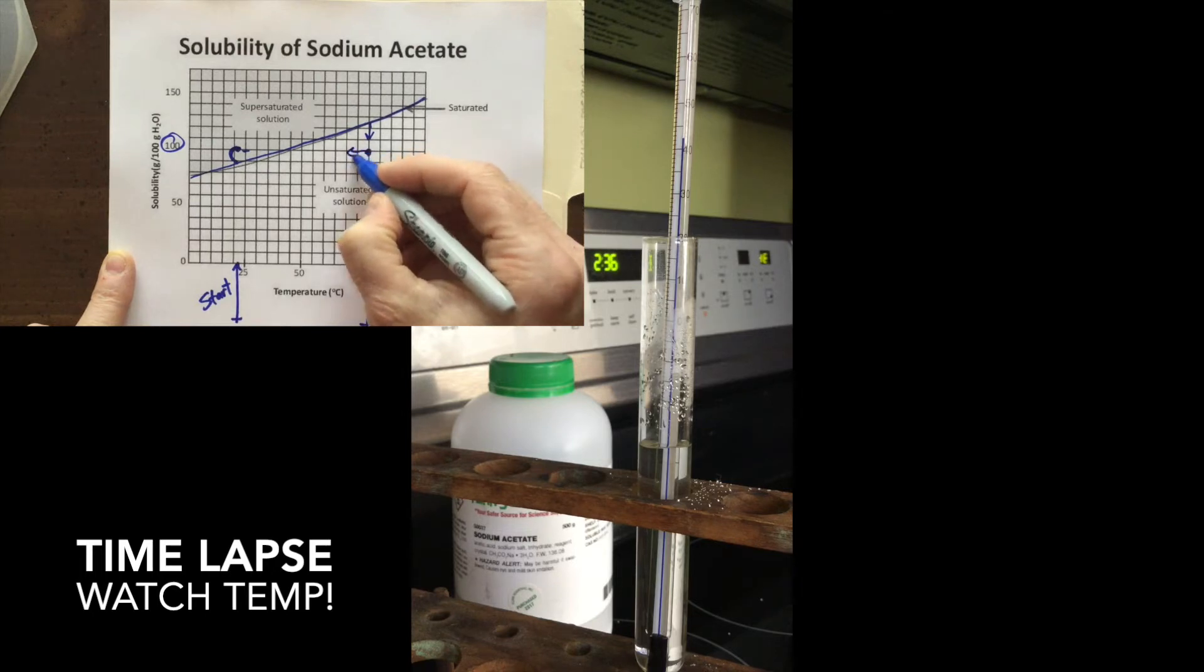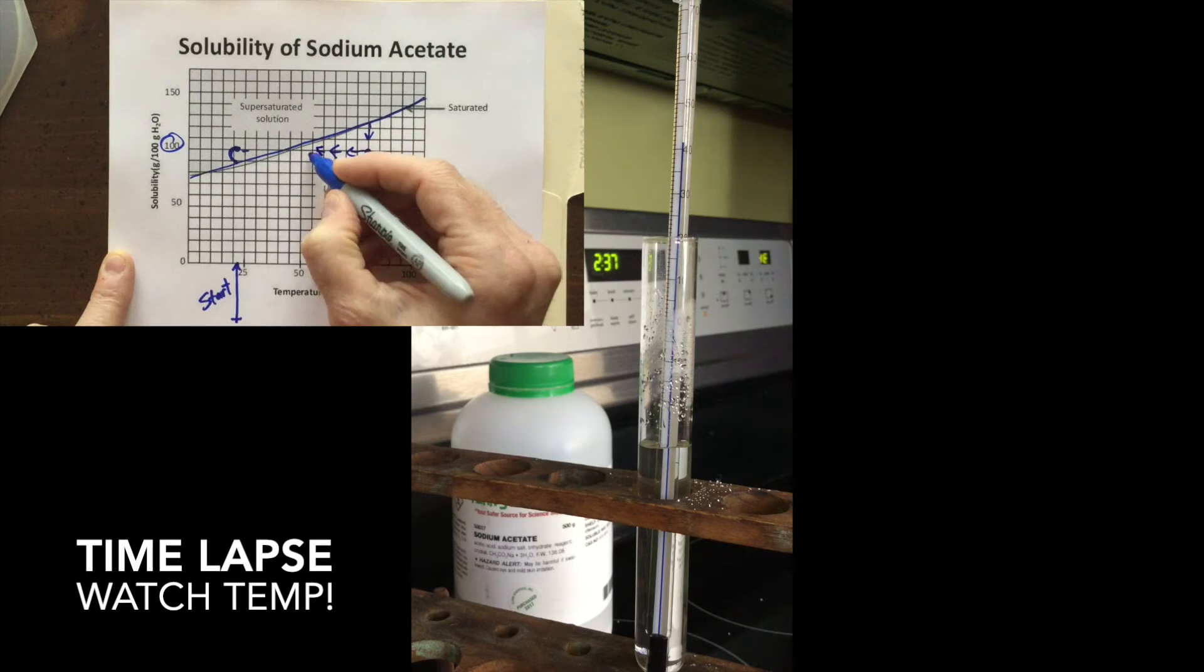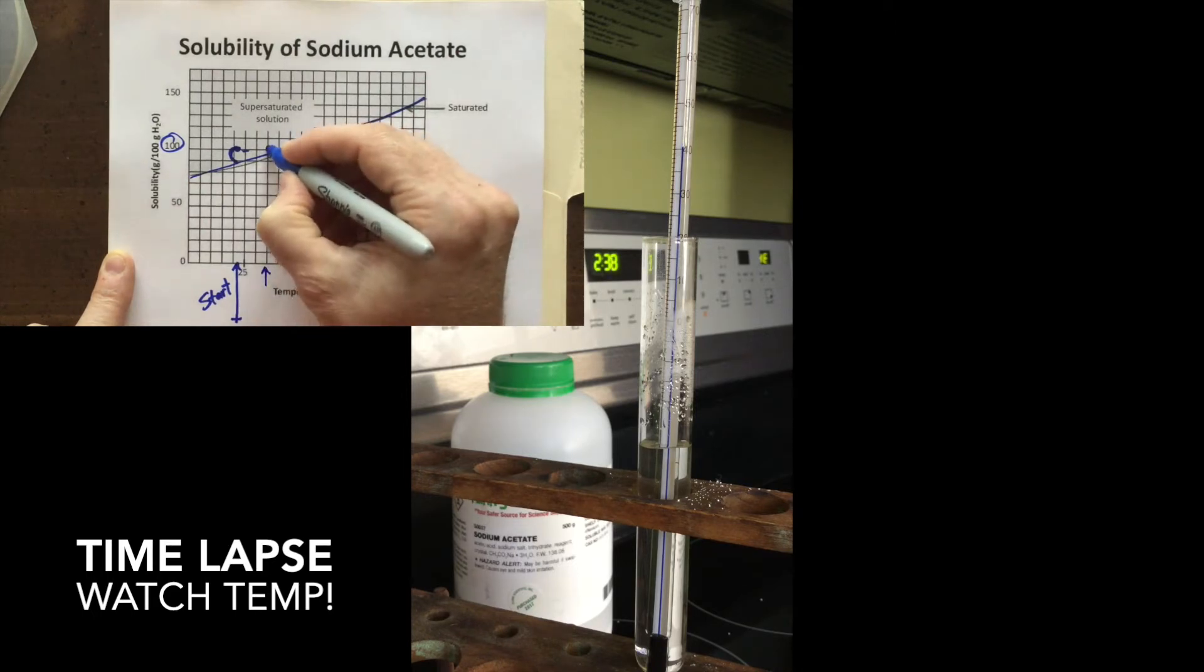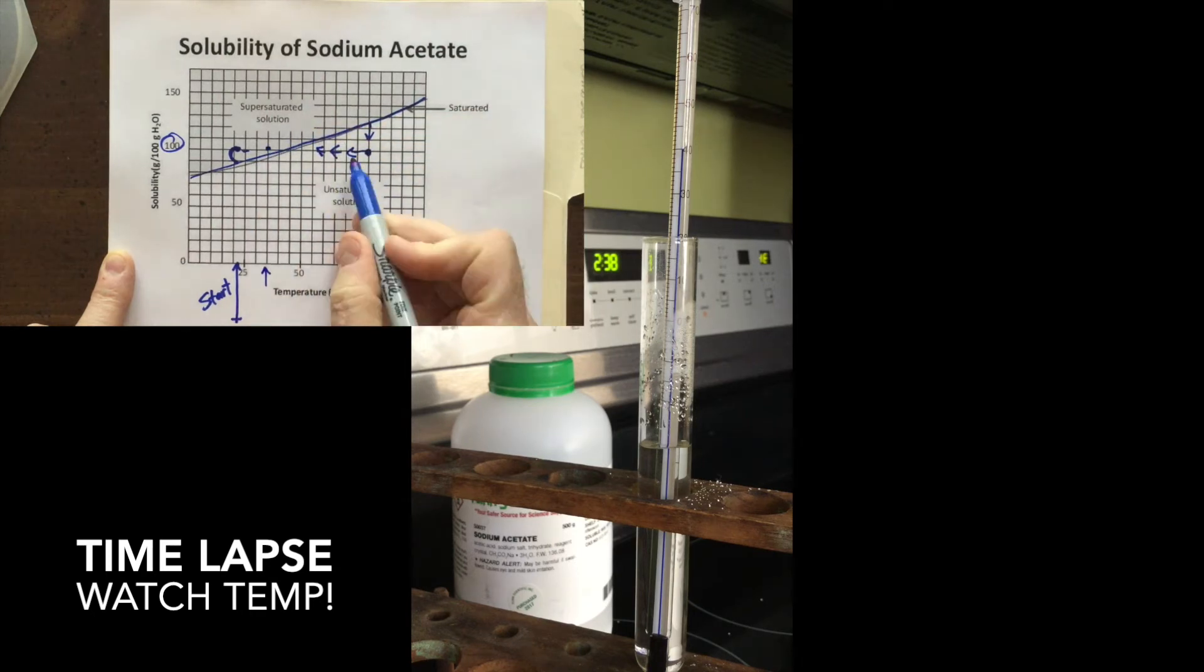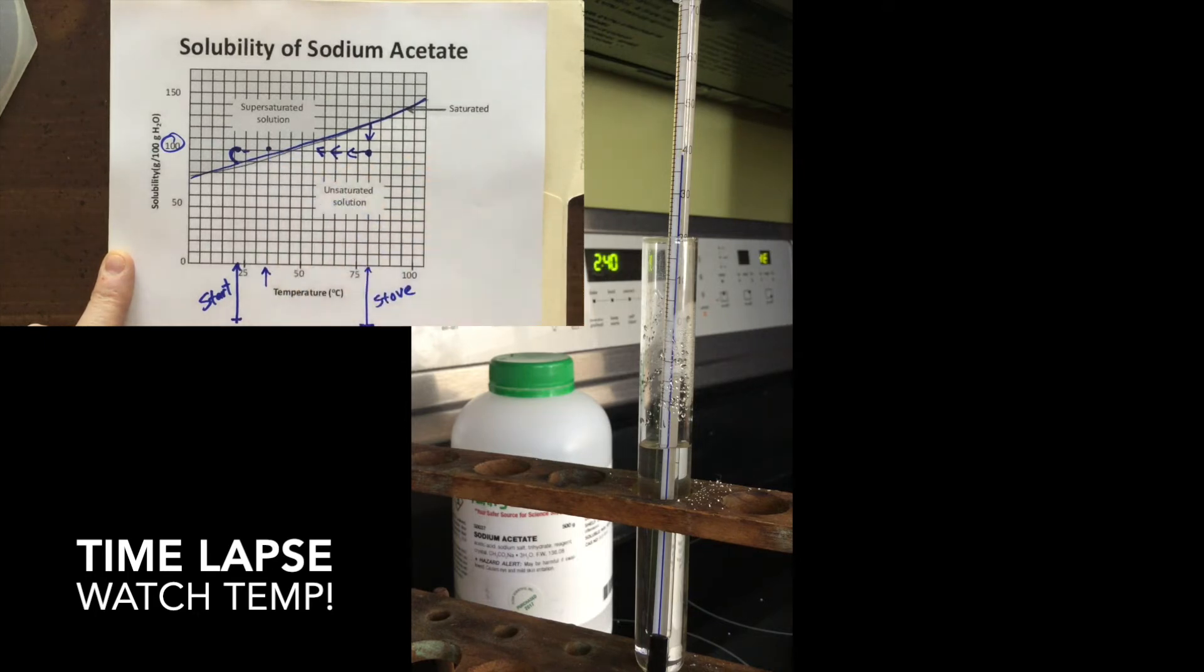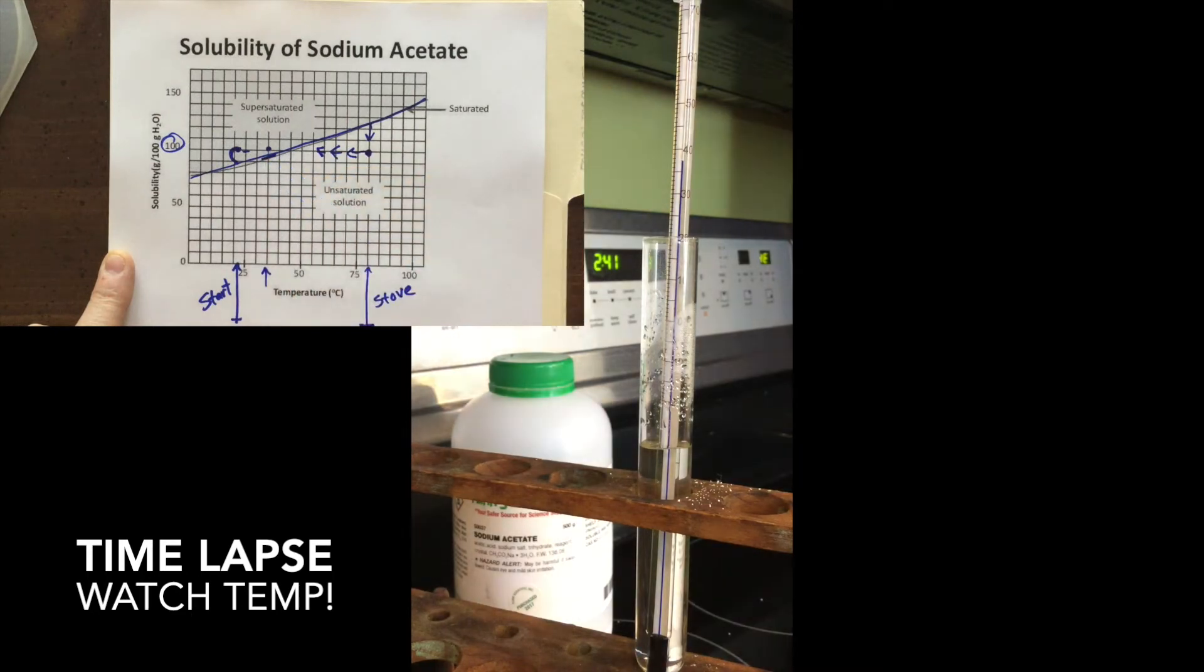It's cooling down, it's cooling down. The salt isn't changing. There's still the same amount of salt. And as we go this way, we're going to keep on letting it cool down until we get to right here, 35 degrees. We want to get right here. When we get to 35 degrees, something interesting is going to happen. It's going to be supersaturated. It's holding more salt than it's supposed to. That solute is not supposed to be dissolved in there. It should be down here. So we are holding more salt in there. It will be supersaturated. And that's what we're going to see what happens next.